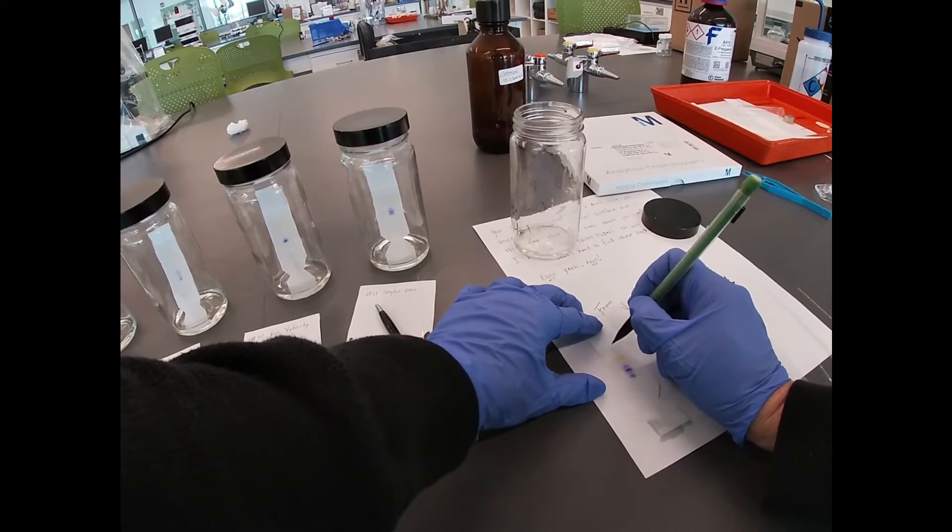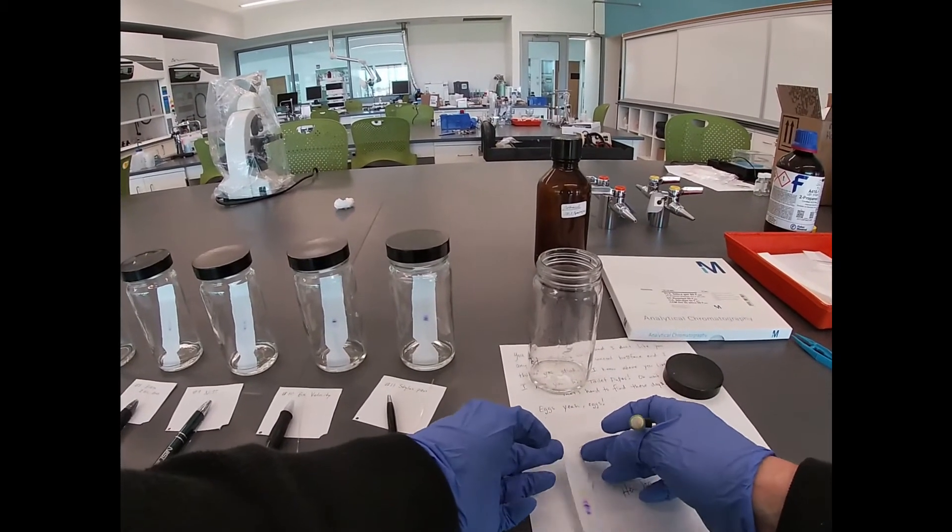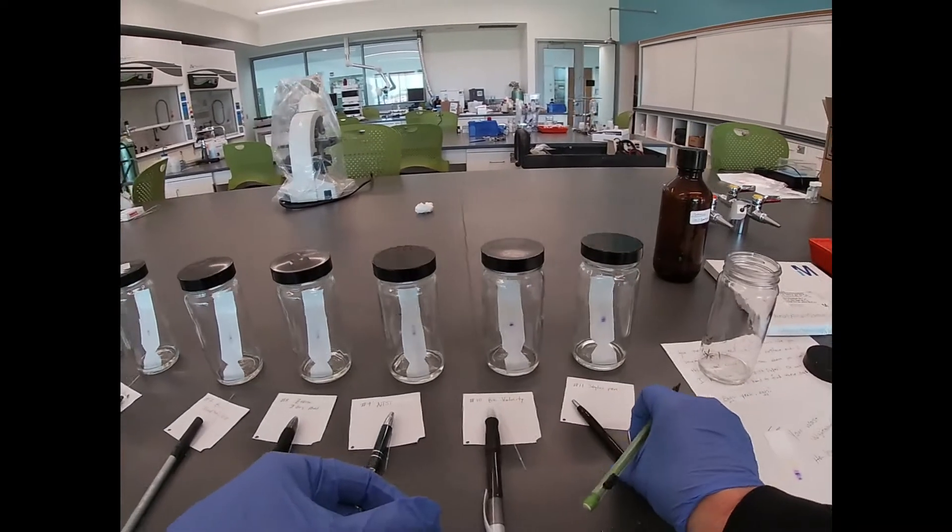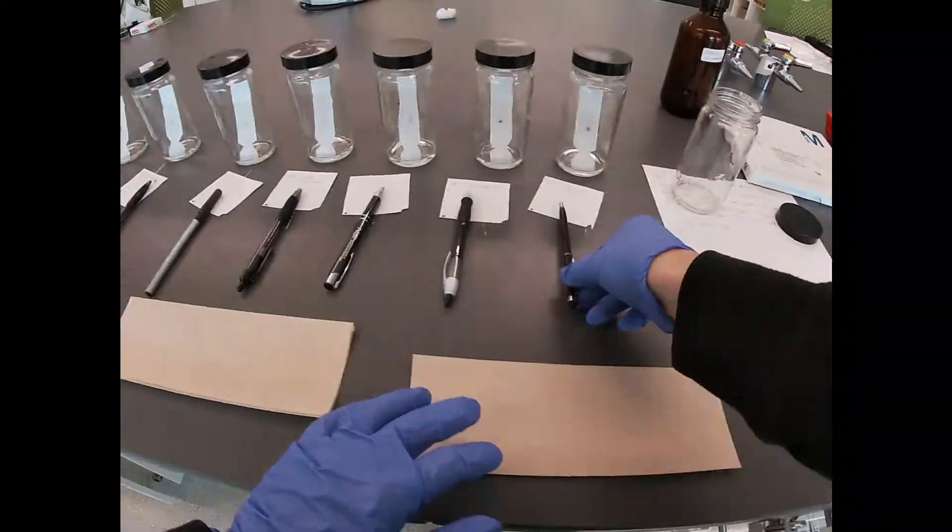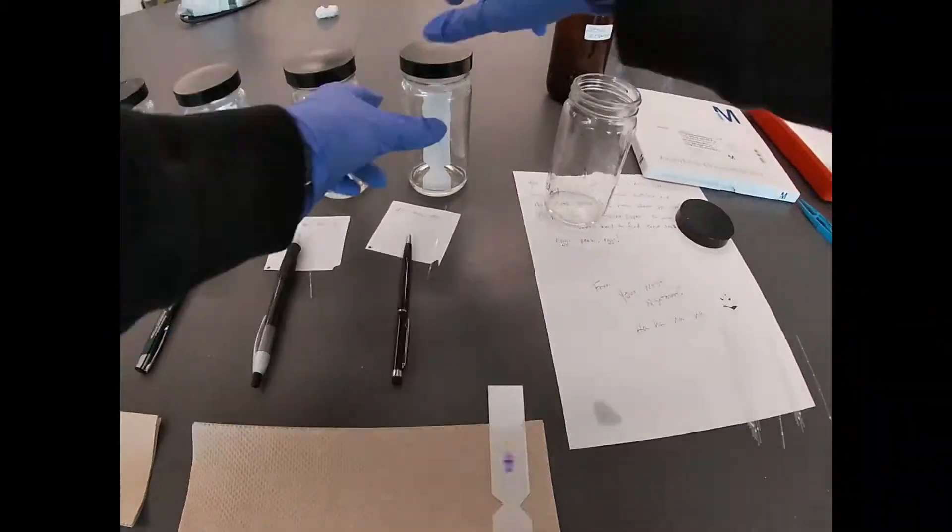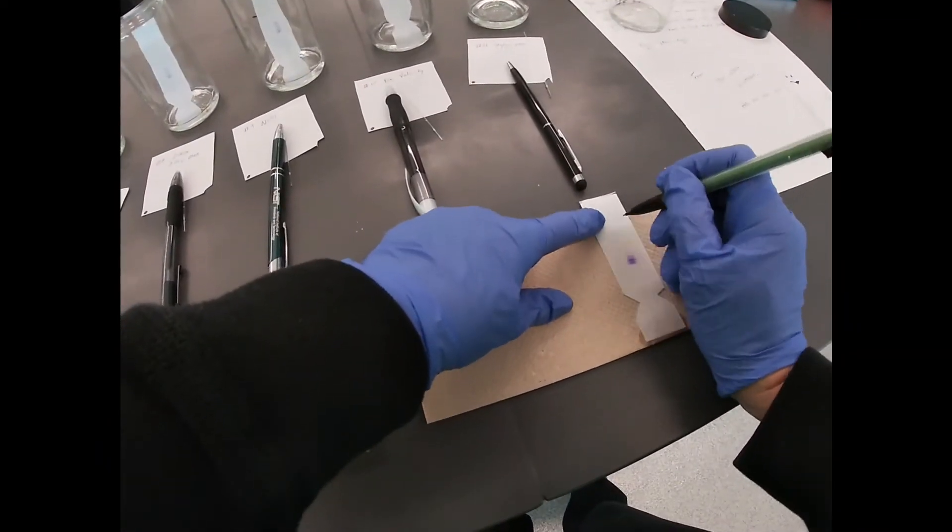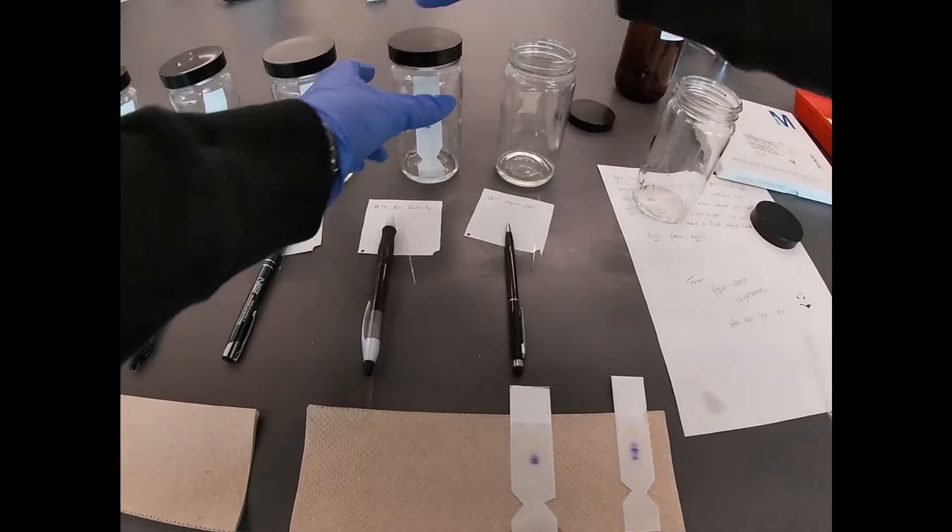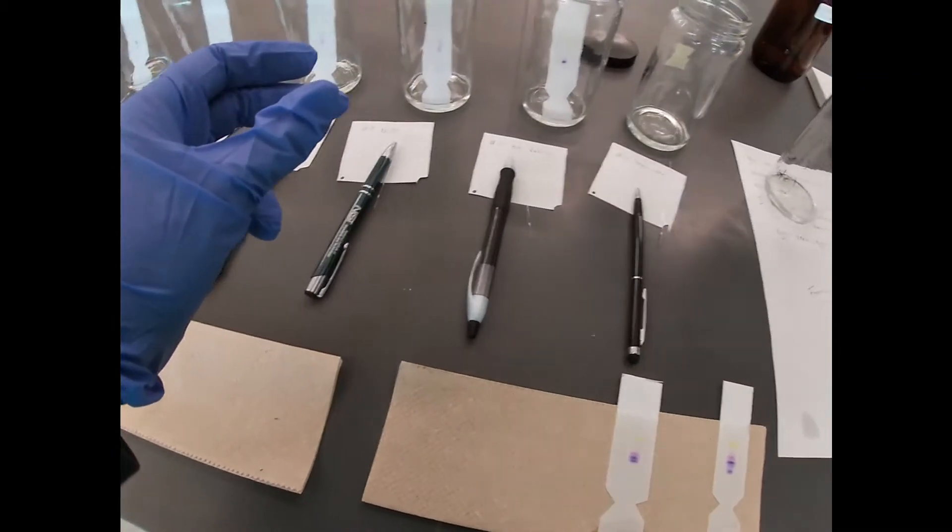Mark the solvent front with some pencil dots. That actually looks pretty cool. Put the lids back on because these are stinky.